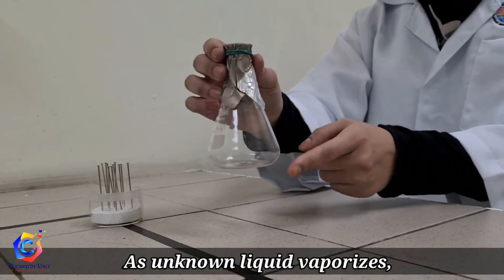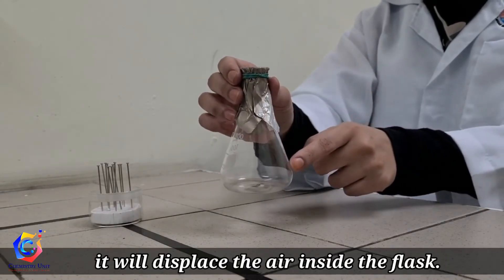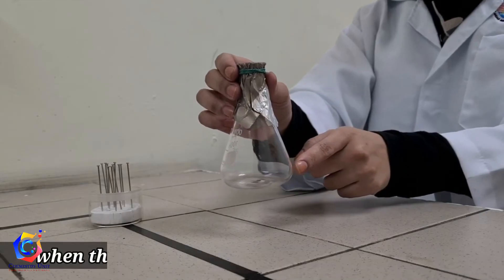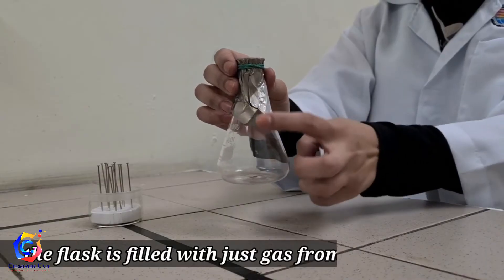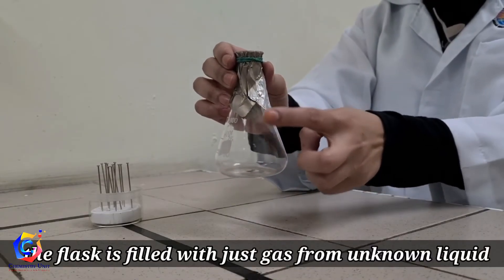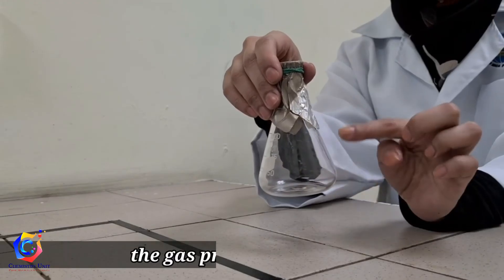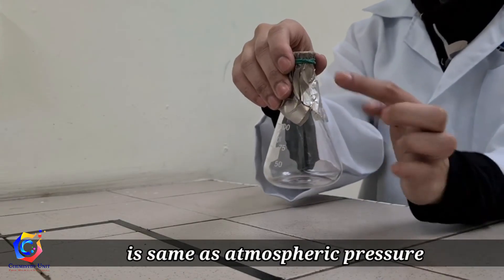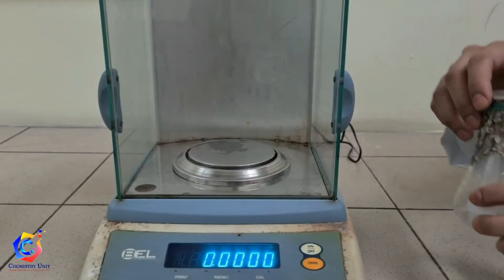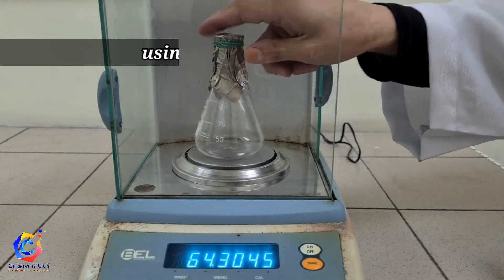As the unknown liquid vaporizes, it will displace the air inside the flask. When the unknown liquid completely vaporizes, the flask is filled with just the gas from the unknown liquid. The gas pressure inside the flask is the same as the atmospheric pressure. Weigh the apparatus accurately using an analytical balance.